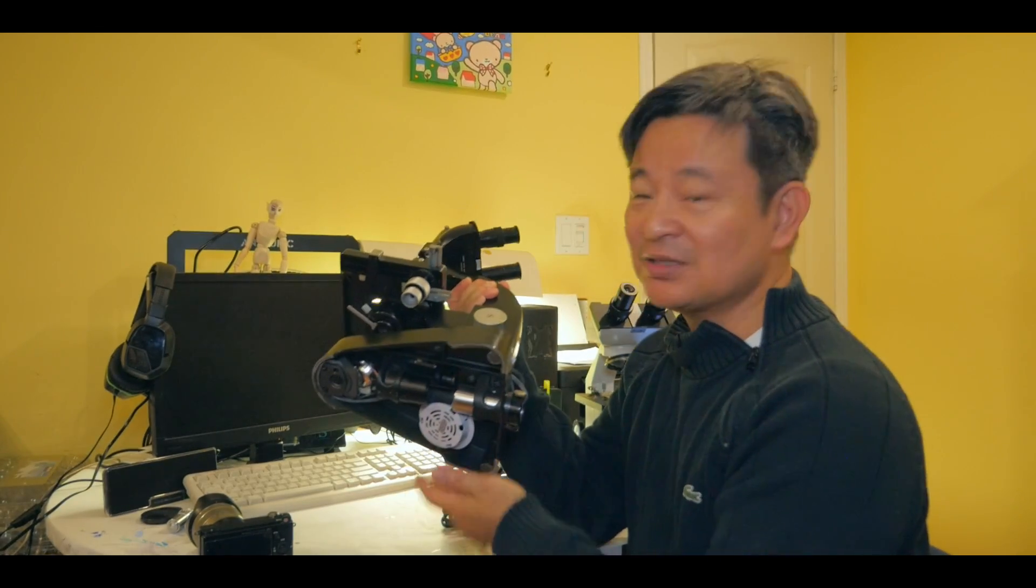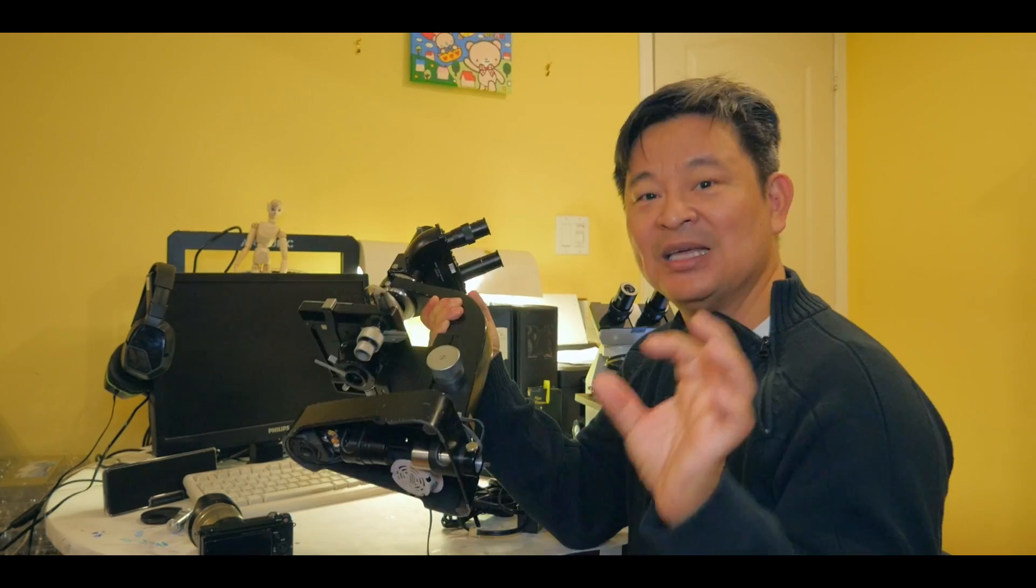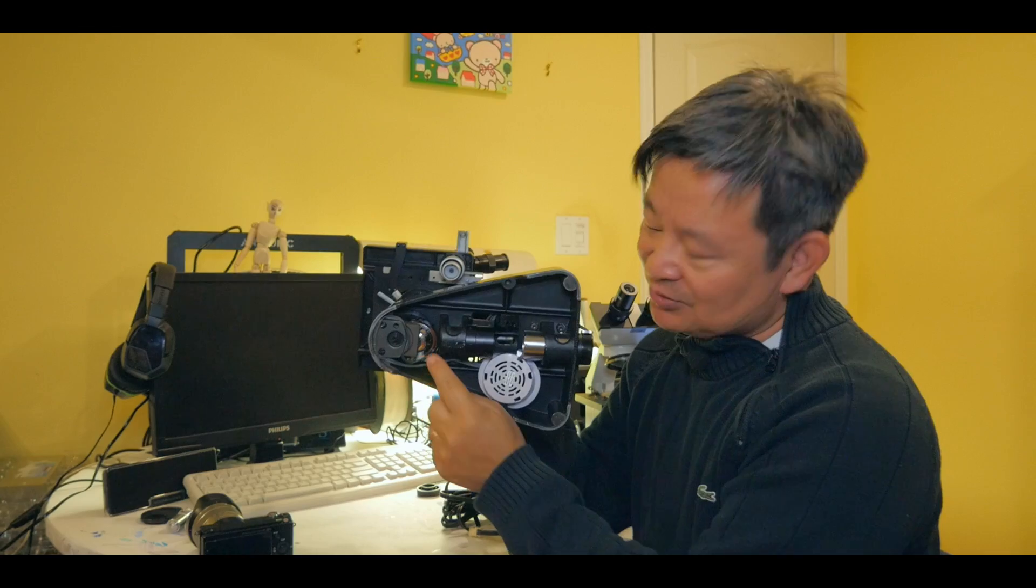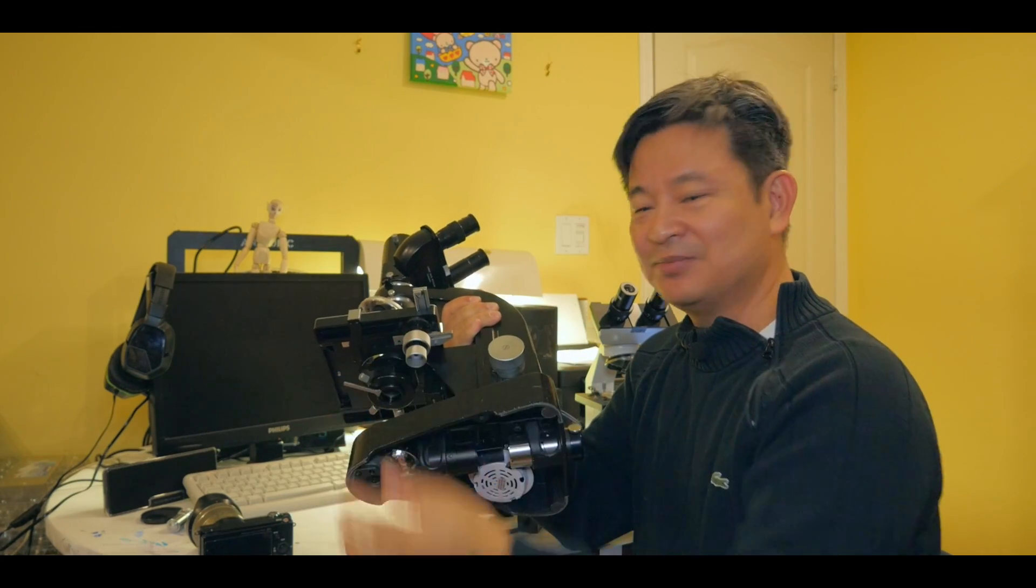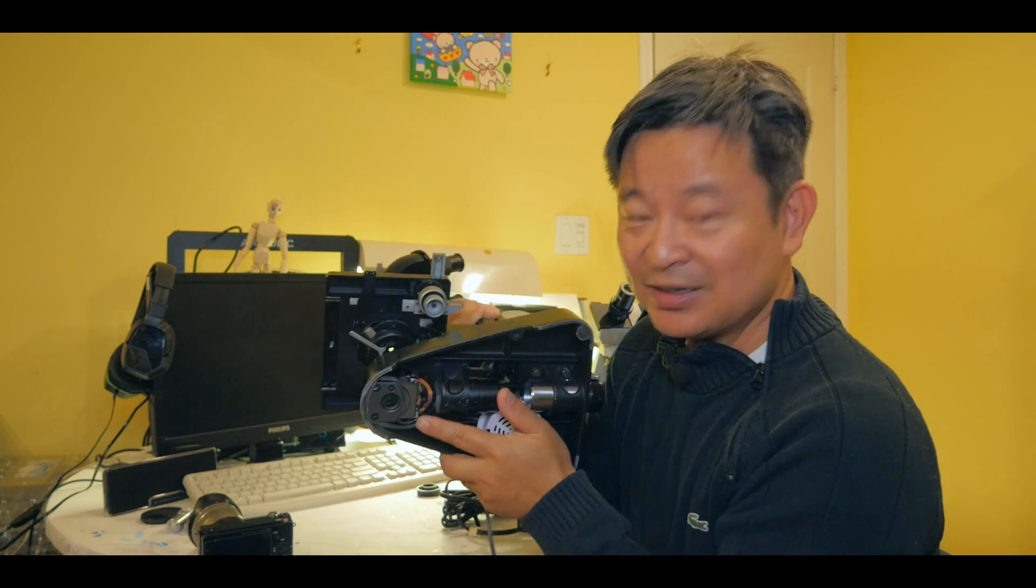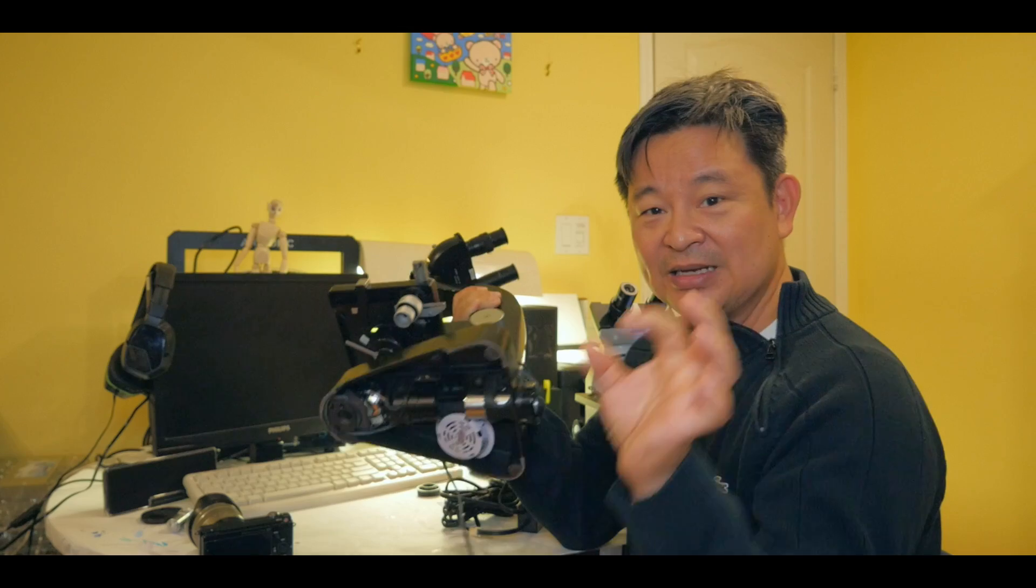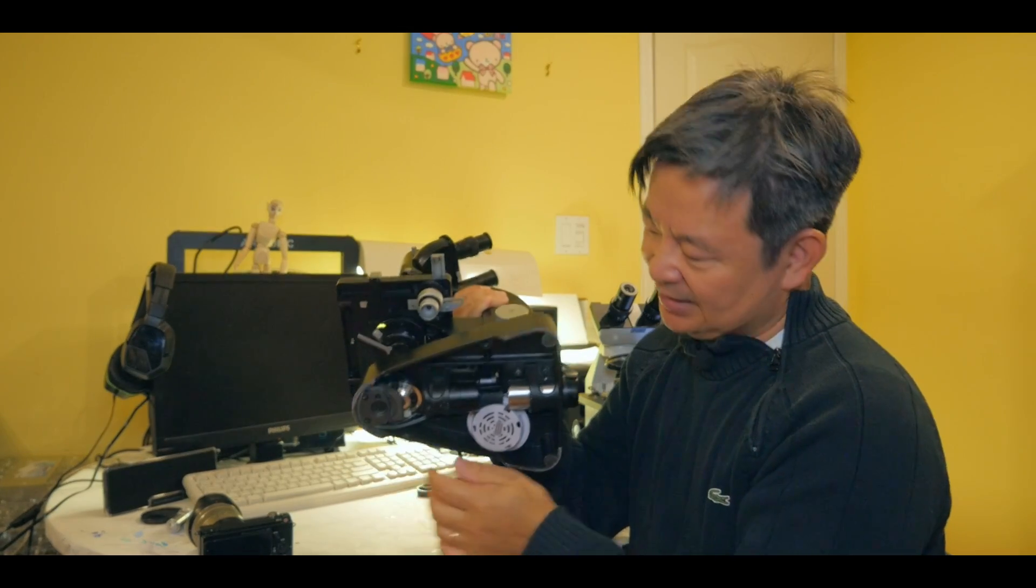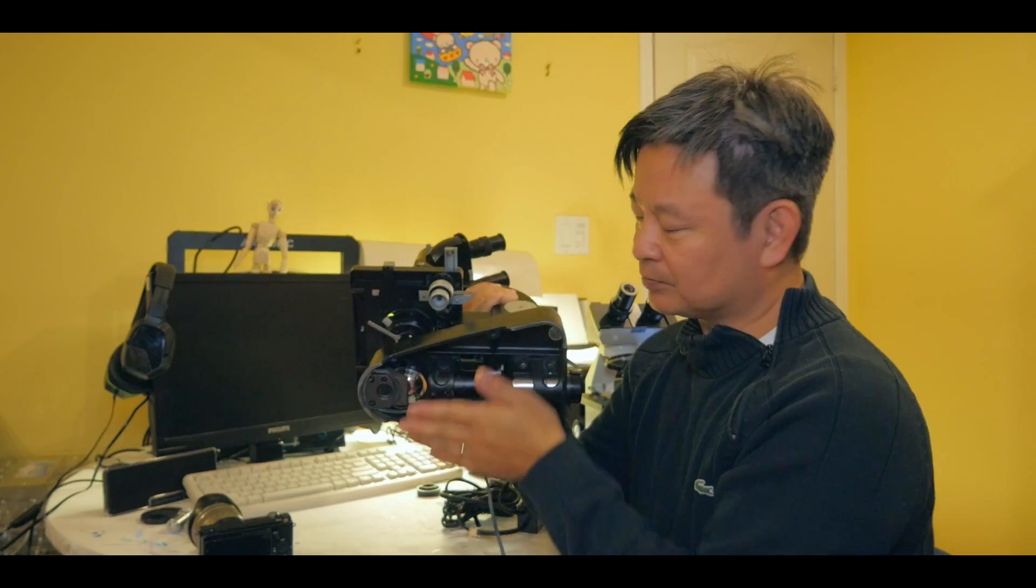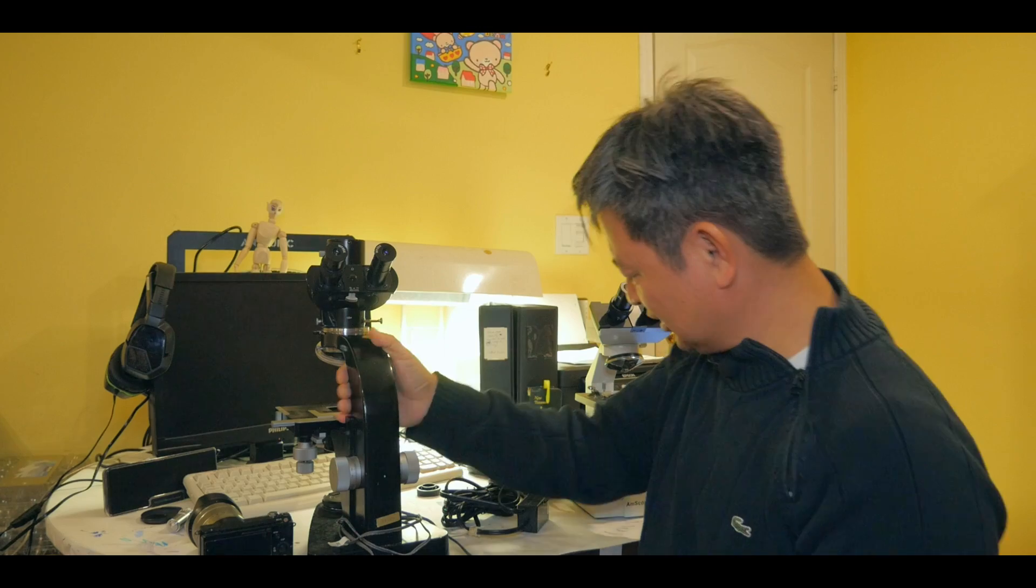So I have this halogen light. This is a 20 watt light power. It was flat. And what I am happening is that I put it directly into the condenser where the light comes in there, right? So you can see here, I don't know, you can see that there's a round light source. It has a halogen, very tiny lamp that's 20 watt, and it's hooked up and placed inside here. And you can see the wire to connect to my transformer.